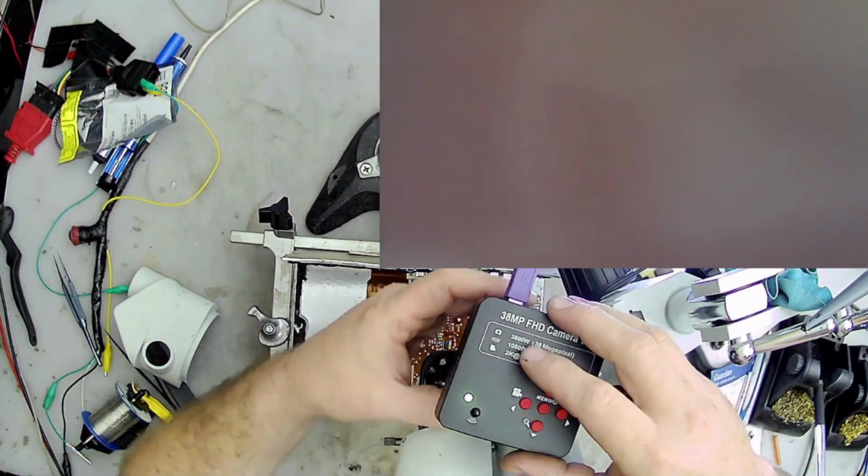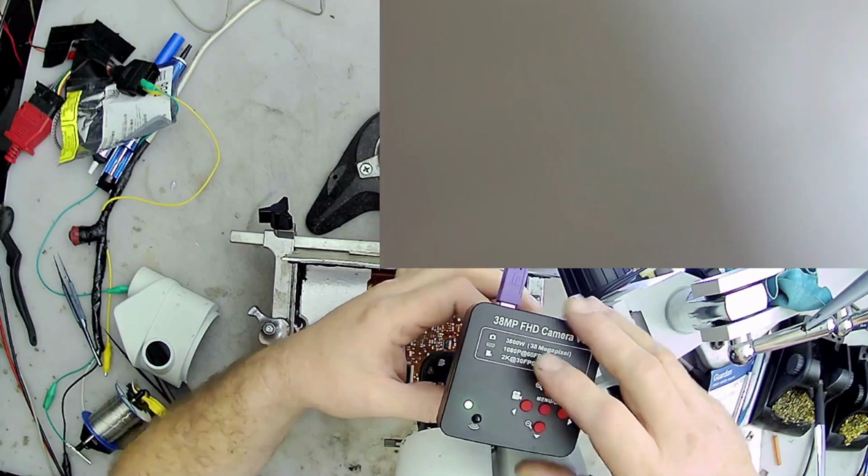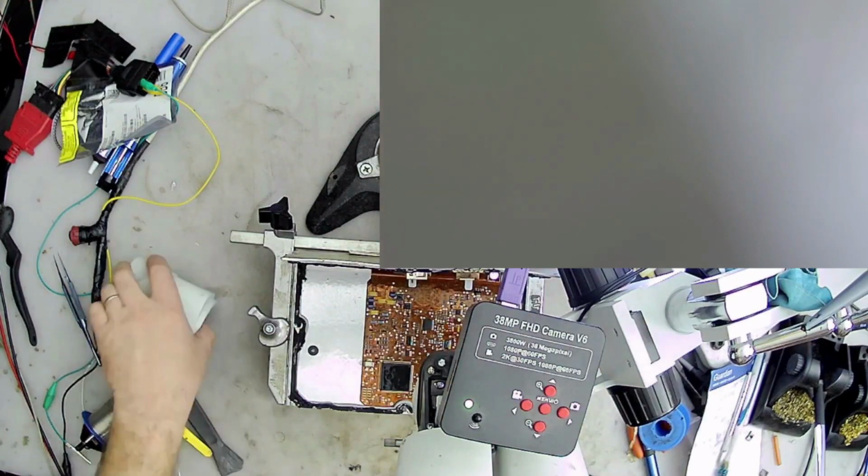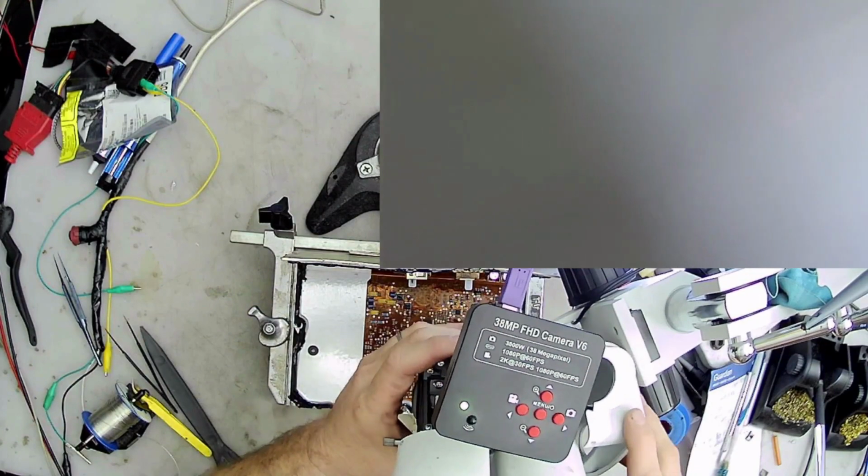And plus, I forgot my lens. My lens is off right now. So I think I realized there's too much light. And then, yeah, I put the case on. And then I realized I have to put my lens on.